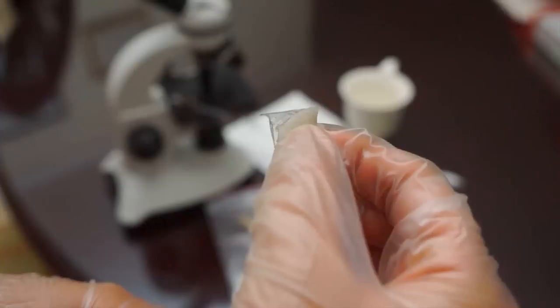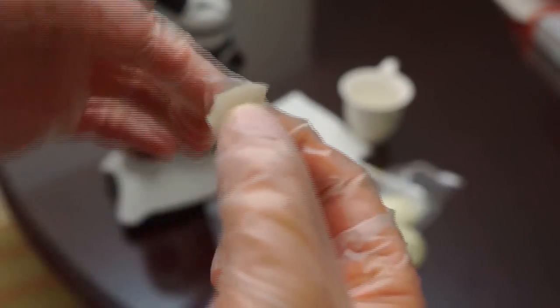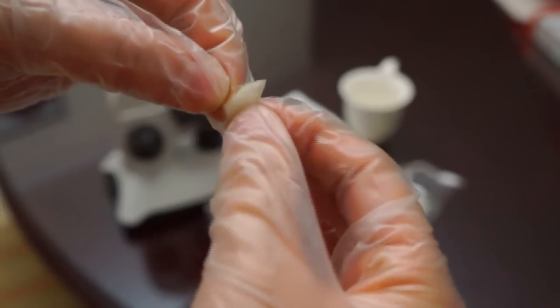When you see that you can just peel it off or take it out from the big part. Then we will see that some peel off. From there you can see whether it is from above or below, you just peel it to bring out a little bit more.